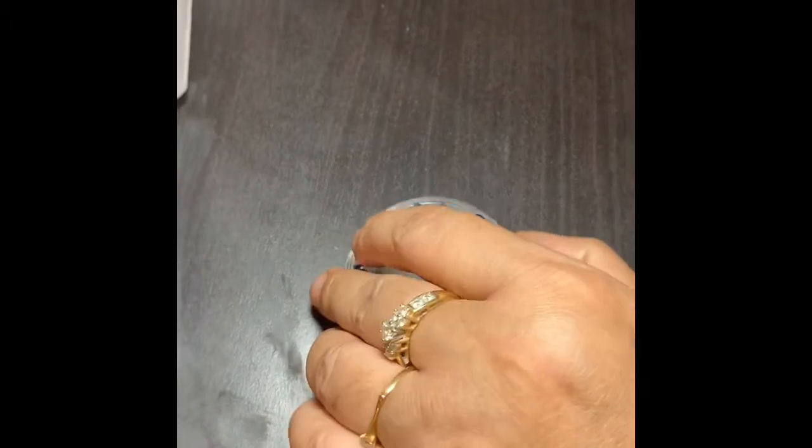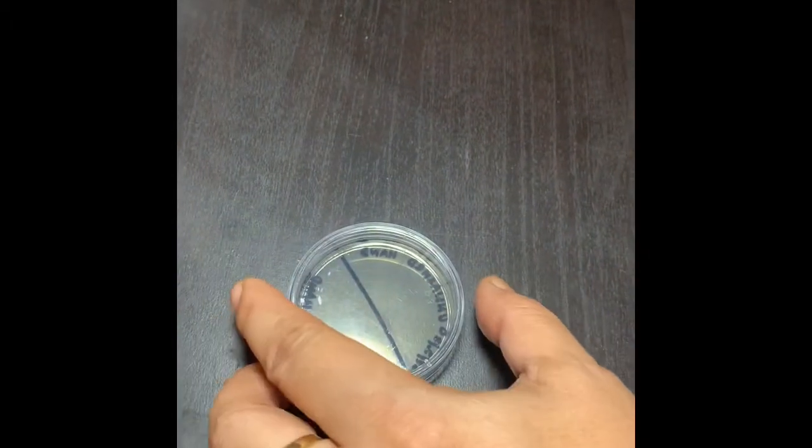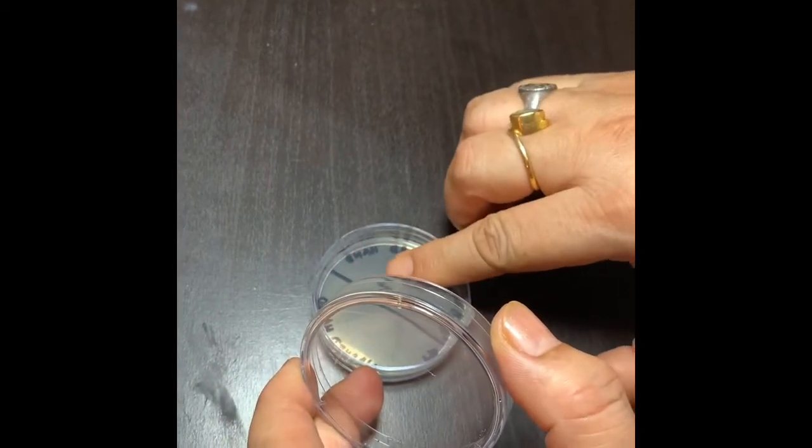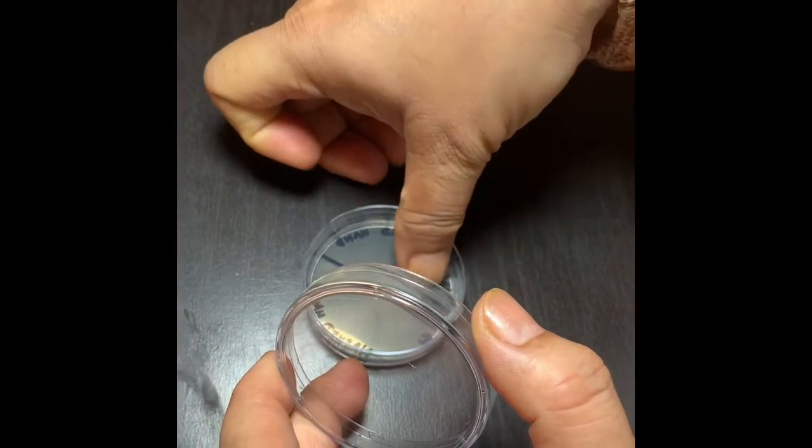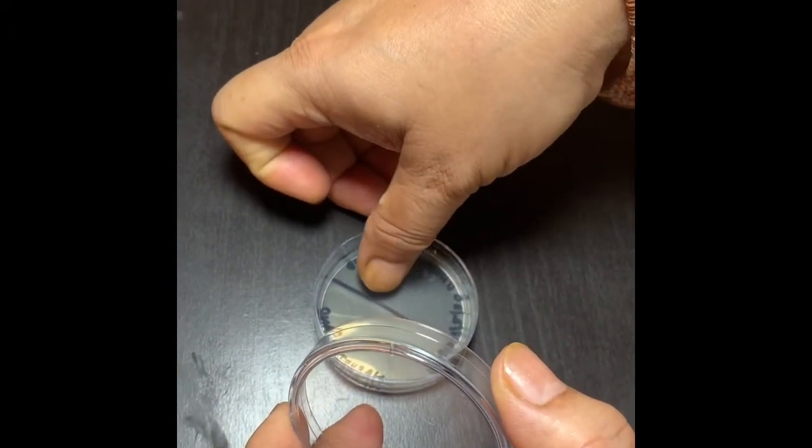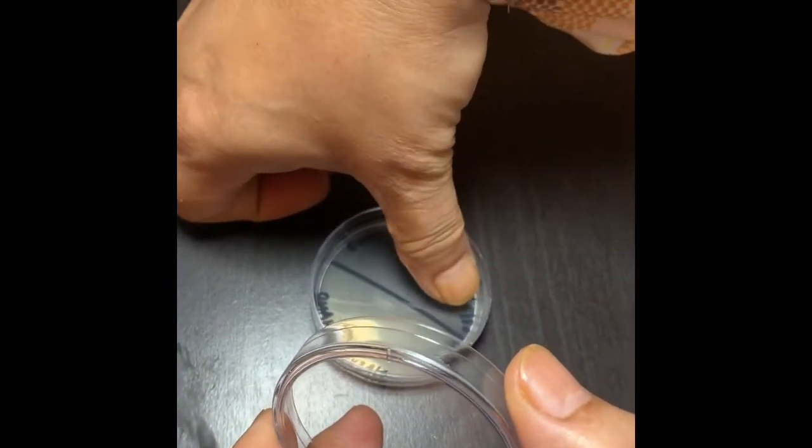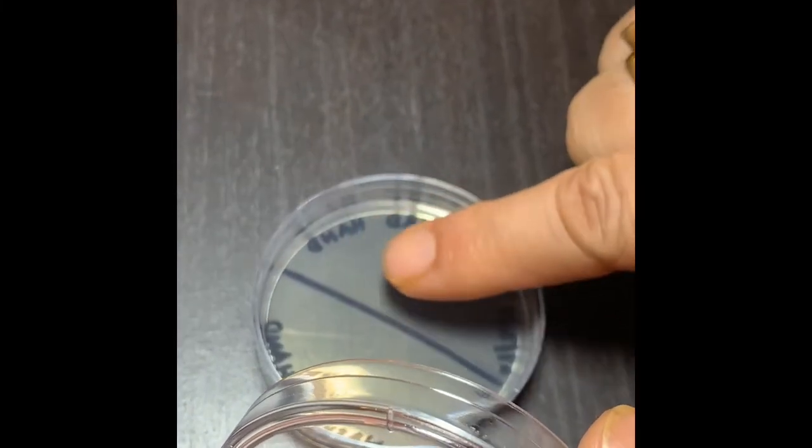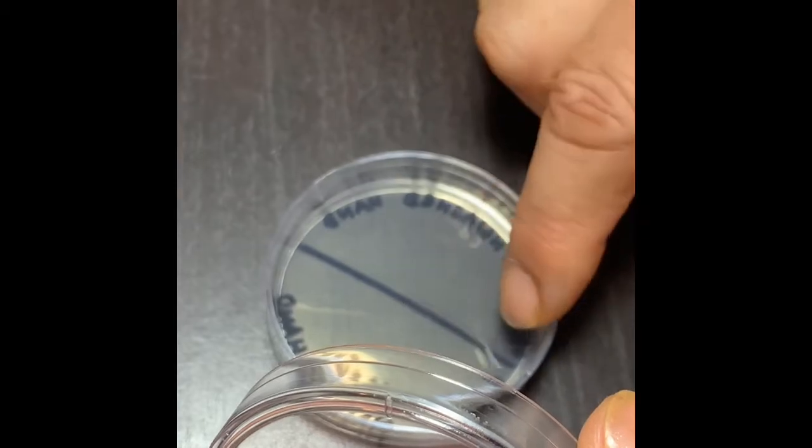So first, I will take this plate and touch the agar plate with my hand on the half where I said unwashed hand. Make sure that you don't touch the portion on the other side.